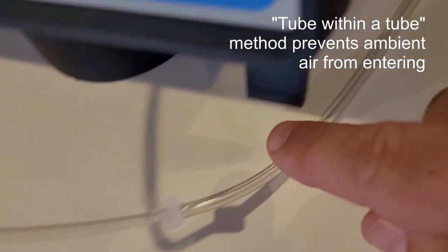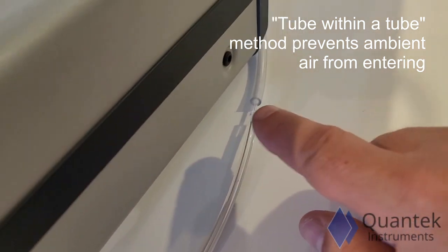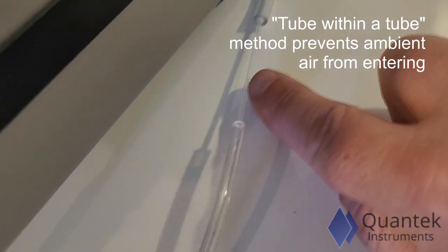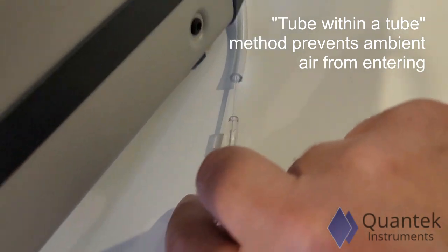We'll be using the tube within a tube method. We'll have a small tube inserted into the larger tube where gas is flowing.